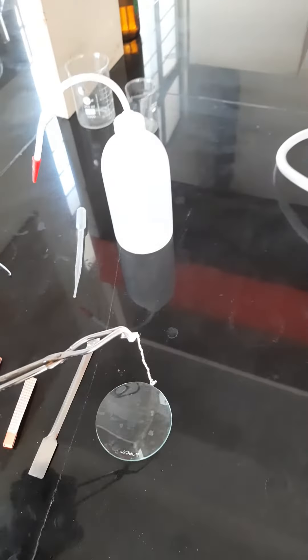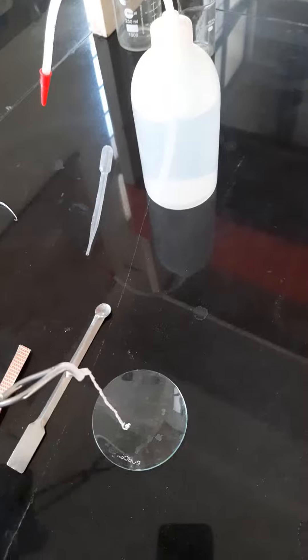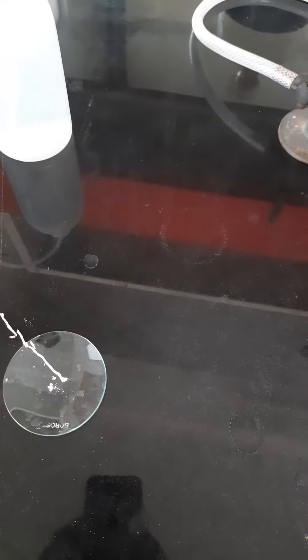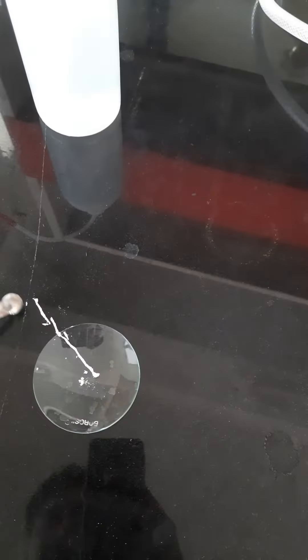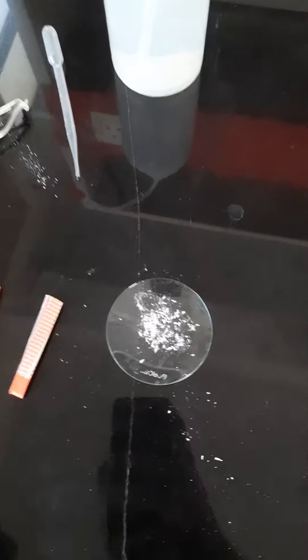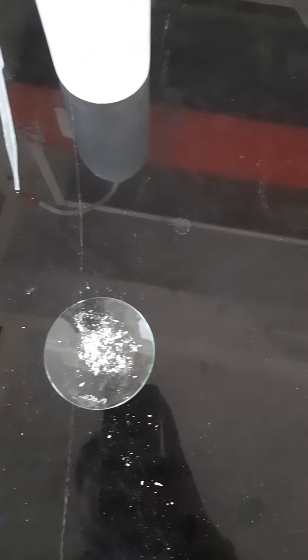White dense fume is produced. And this white powder, after the reaction with oxygen, is magnesium oxide. We have collected this white powder in a watch glass. It is magnesium oxide.